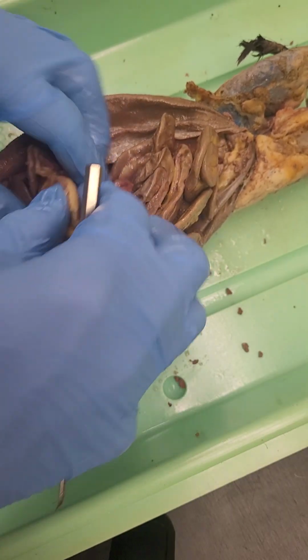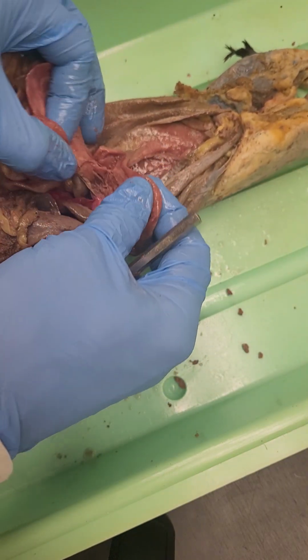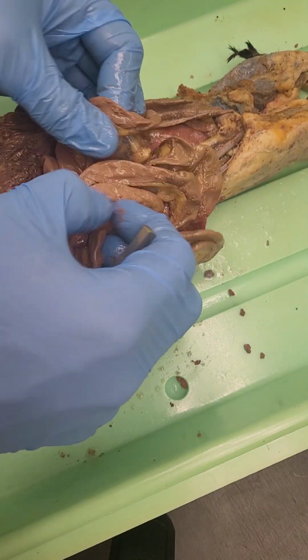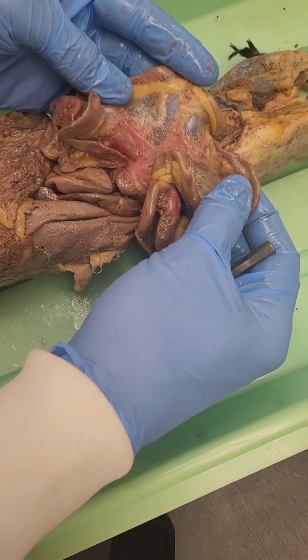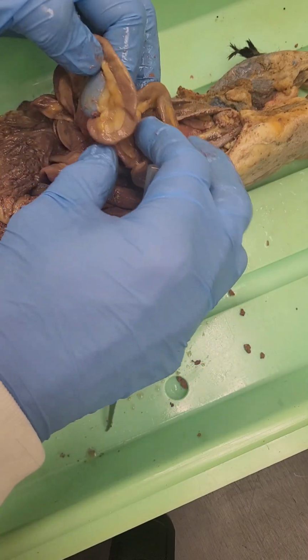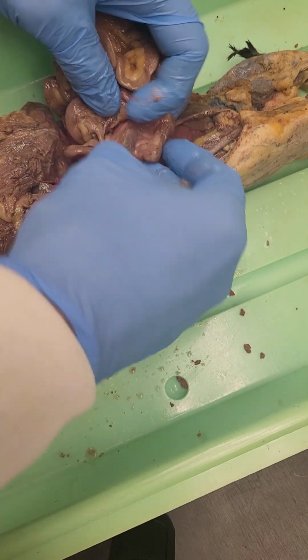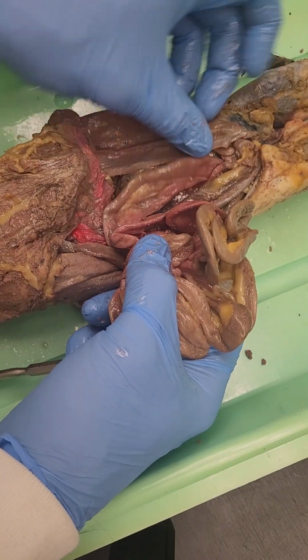Okay. So we'll lift the omentum out of the way now. And one can actually follow the small intestine around the body, and actually you will at some point transition from the duodenum into the jejunum, and then from the jejunum into the ileum, and you'll see that there's lovely mesenteries providing blood and lymph all the way along the intestine. Okay, so it's held together in a sort of spiral structure. All of these components loop until we start to get to the large intestine, which loops around the top and then down here to exit out of the colon and the rectum.